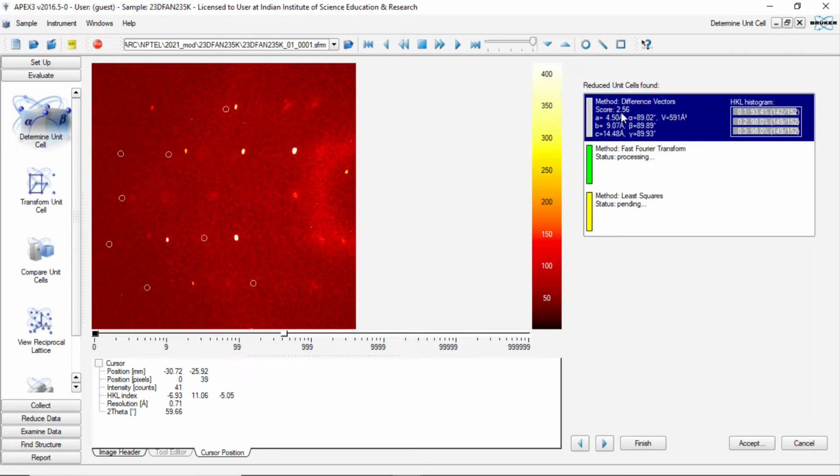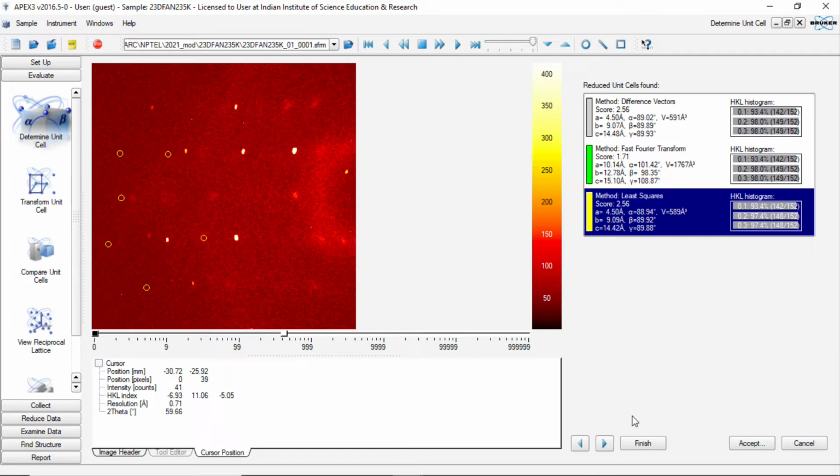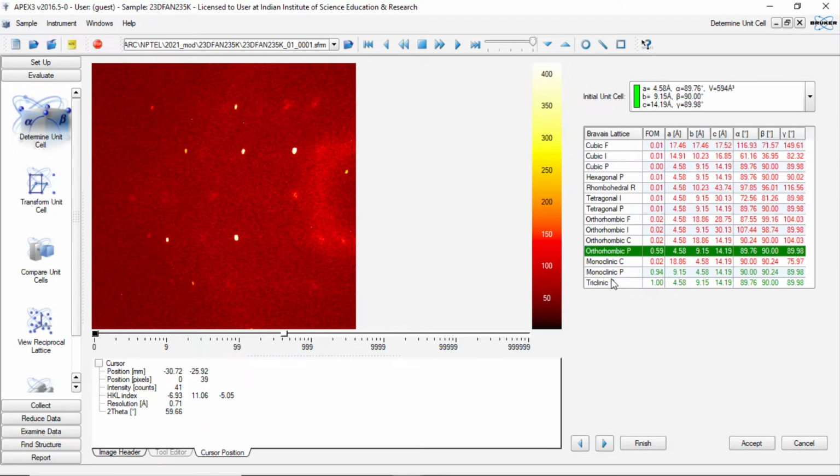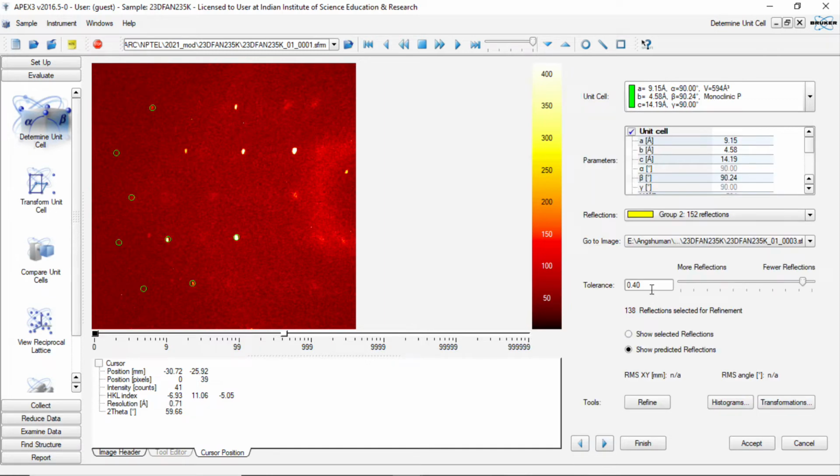So now with those yellow reflections, it is again giving the same unit cell 4, 9, 14, right? Then it gives something else, and again 4, 9, 14. So 4, 9, 14 is probably the correct unit cell. You make the tolerance again to 1 and refine a few times to see the ESD is coming down to the third decimal places. Then again we take the monoclinic P. Here it gives you 90.24. Refine it once again with the tolerance 1.